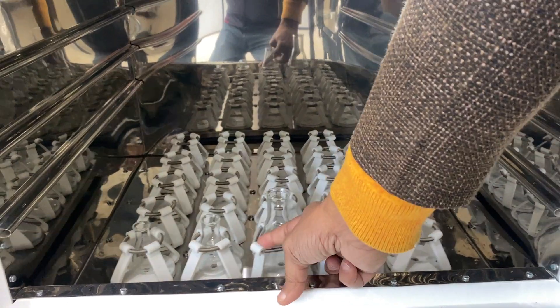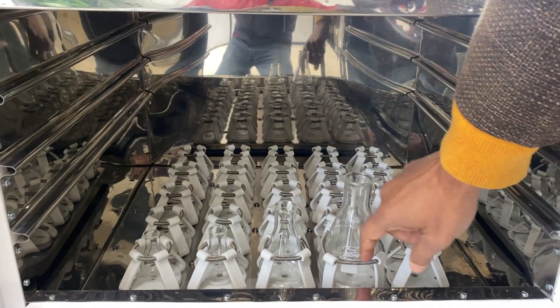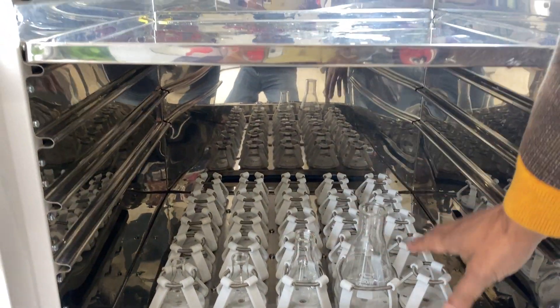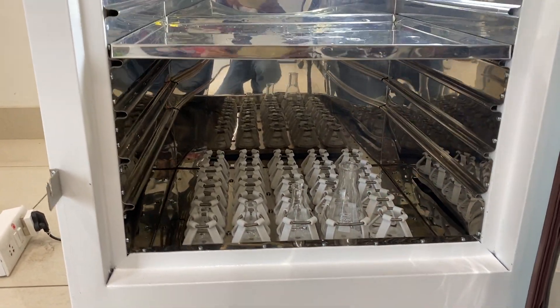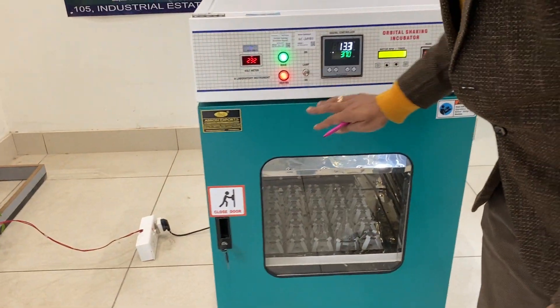This is a lotus type of holder. You have to open it by hand and then take it out. For the bigger one, you need to push with both hands and somebody else will put the flask inside. The capacity is five trays — five into five.